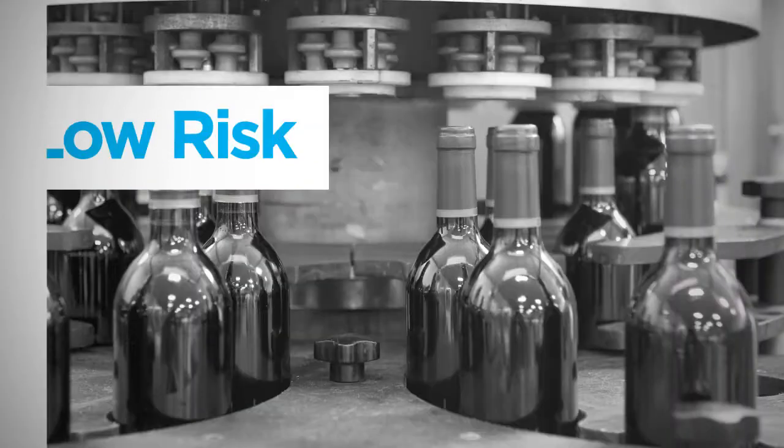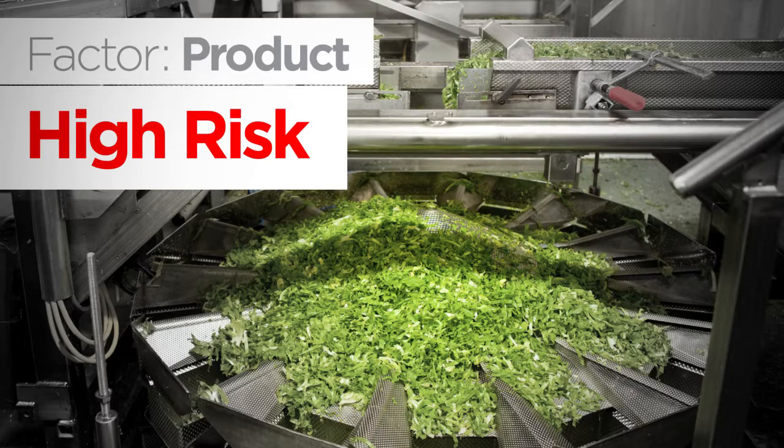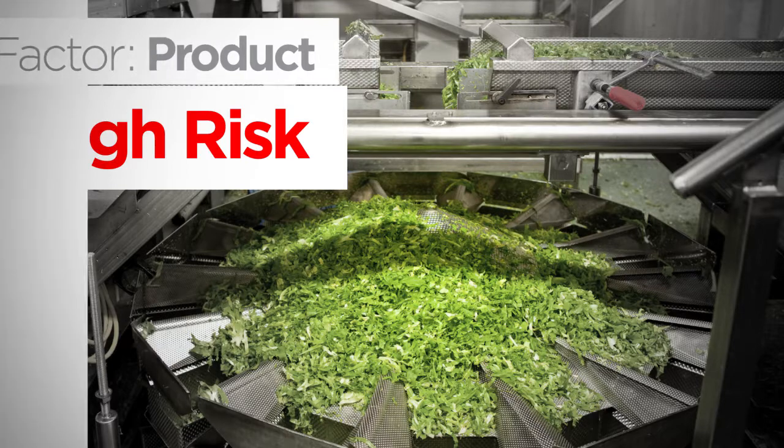The last factor is the type of product. Products with a lower risk of contamination, such as cooked products or products with a longer shelf life, can have higher RLU limits. On the other hand, products with a higher risk of contamination, such as ready-to-eat products and products with a short shelf life, may require lower RLU limits. To determine custom RLU limits for your facility, complete this 4-step process. Identify, clean, test, and calculate.